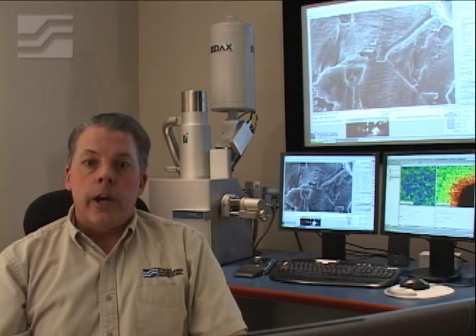We examine small objects like medical devices, including catheters, stents, and artificial joints. We look at fibers from rope, fabrics, and insulation. We also examine foreign materials like tiny particles, including fragments that cause eye injuries.